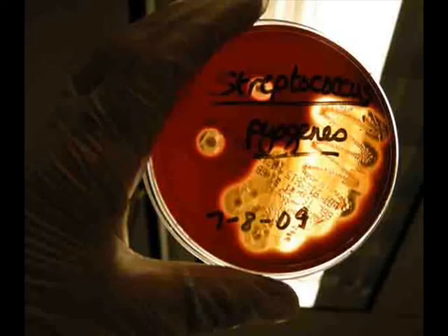If I see beta hemolysis on blood agar created by a bacteria that I suspect of being Streptococcus pyogenes, I can always isolate a sample of that strep on another plate and then do a bacitracin test. A bacitracin test would involve exposing the bacteria I suspect of being Streptococcus pyogenes to an antibiotic disc that has bacitracin on it. Bacitracin will clear the area of Streptococcus pyogenes.